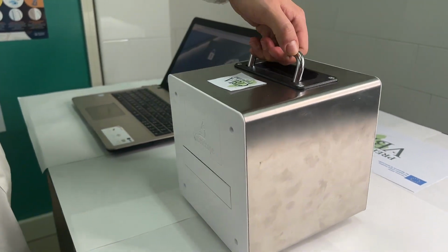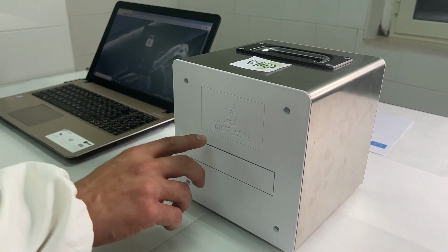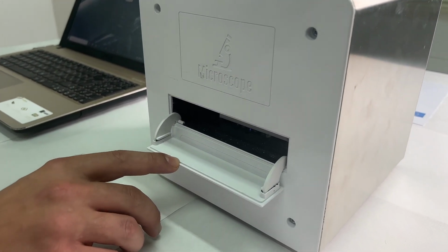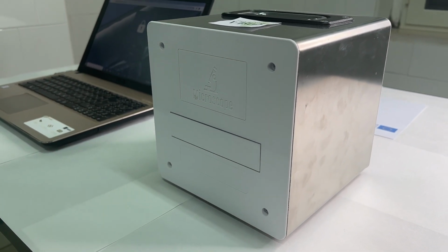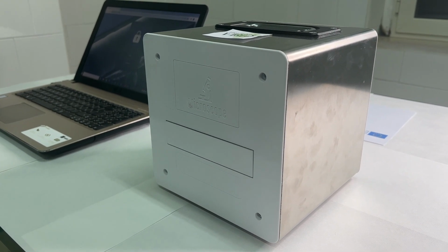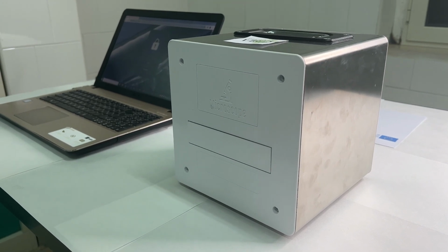It is composed of a mechanical part, which allows the movement of the slide tray, first, a slide tray that can come out from the device, in which it houses the Mini-FLOTAC or FLOTAC. And an optical part consisting of LED lights and a digital camera for scanning of the device.